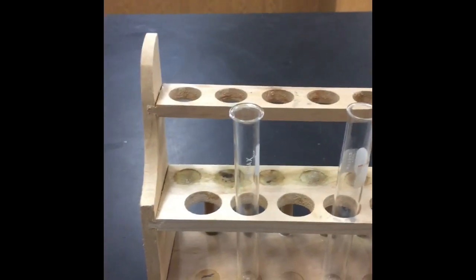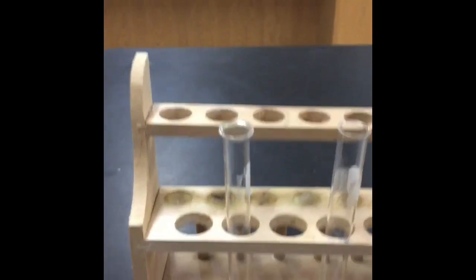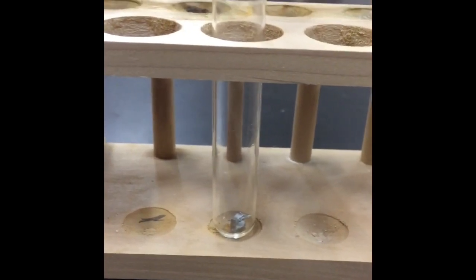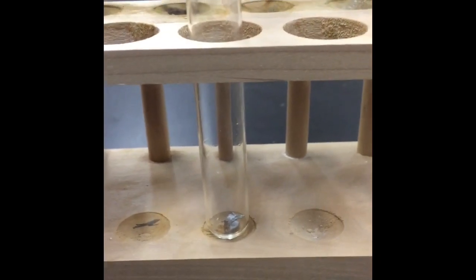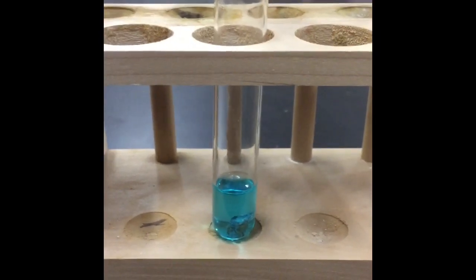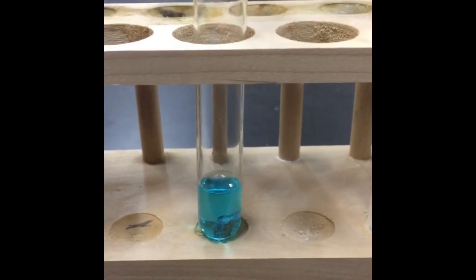Okay, everybody, at lab station 5, we actually had both reactions 5 and reaction 6. So I'm going to do reaction 5 first. The first thing I'm going to do is place a small piece of solid zinc in the test tube. So I'm just placing a small piece of metal in a test tube. To that metal, zinc metal, I'm going to add copper 2 chloride. Okay, so this is reaction 5. I've put zinc metal and copper 2 chloride together. Those are the reactants.